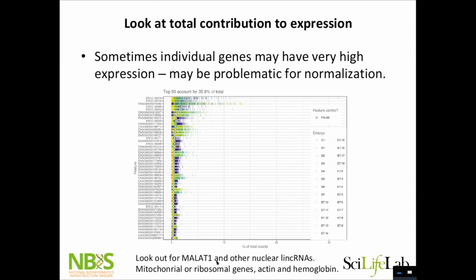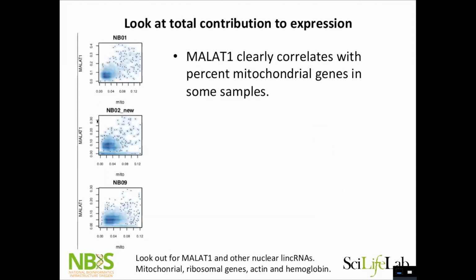And quite often that one gene is MALAT1. It's a nuclear long non-coding RNA. There are other nuclear long non-coding RNAs that also pop up here. I don't really know why, but it seems to clearly correlate with quality of the cells. And that could be also plasma membrane breaking, all the cytoplasmic RNA leaking out, and what you're left with is nuclear and mitochondrial RNAs. I can show you. So here are some plots from a data set I have. Here is mitochondrial proportion and MALAT1 proportion. So there is a clear trend that it correlates. So looking at these kinds of plots, at what genes I have in the data, I make a decision on what genes to keep.